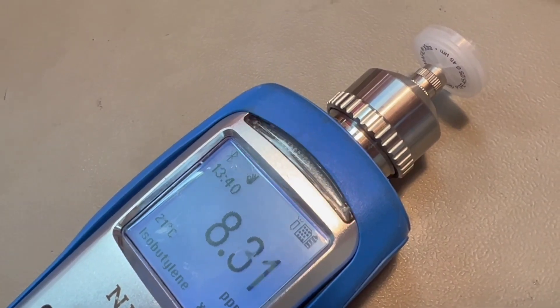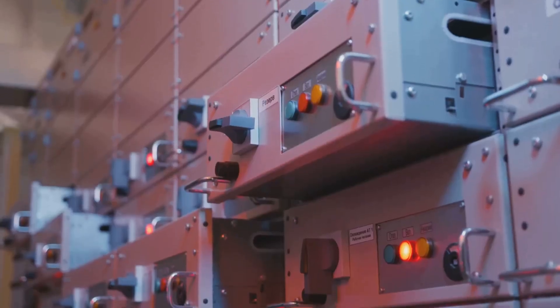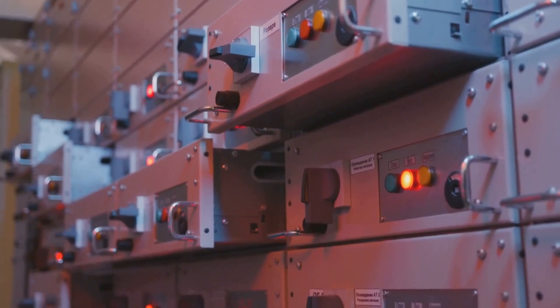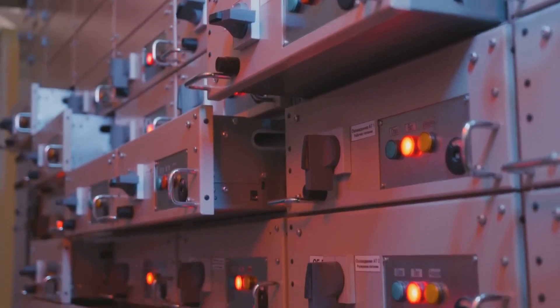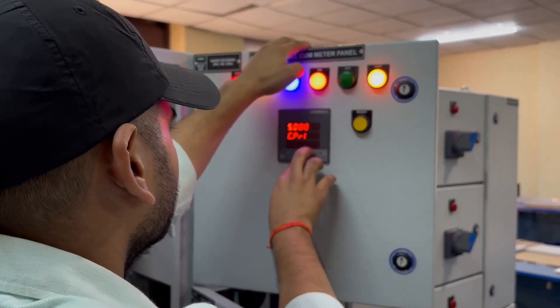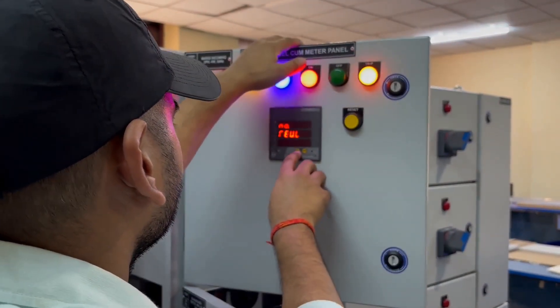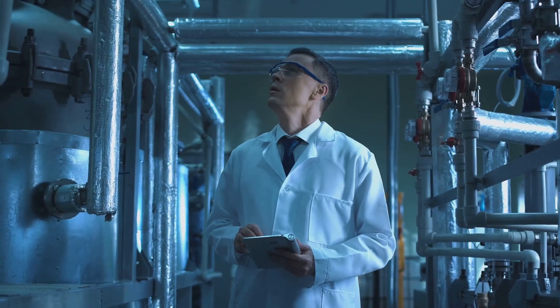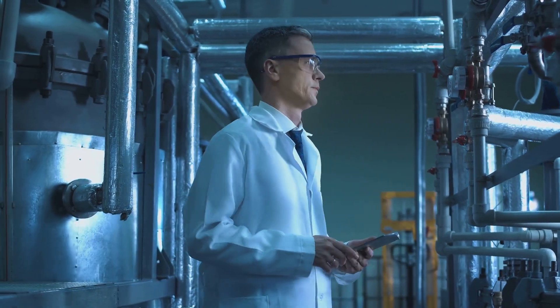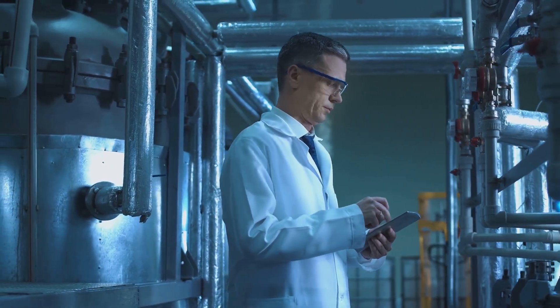The PID amplifies the electrical current from ions, providing measurable VOC concentrations. It gives precise readings in parts per million or billion, helping assess risks. Choosing the right PID and understanding its limitations are key for accurate monitoring.